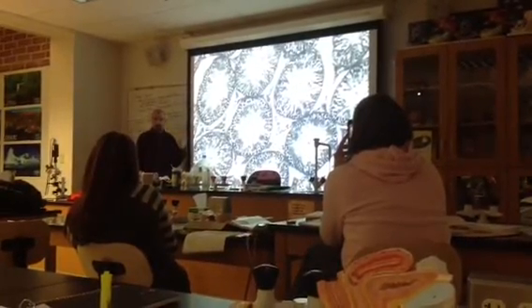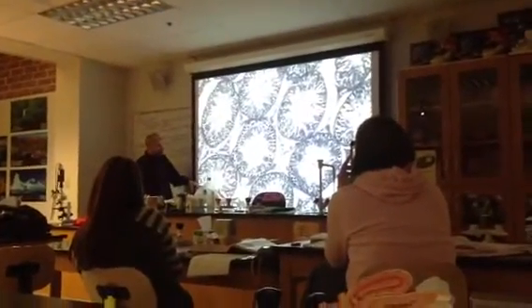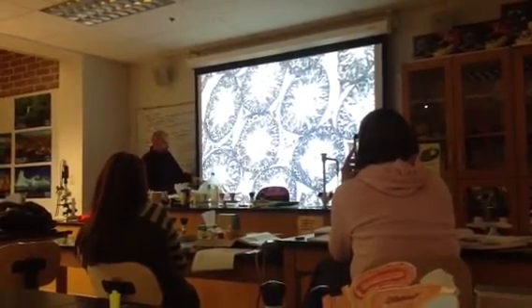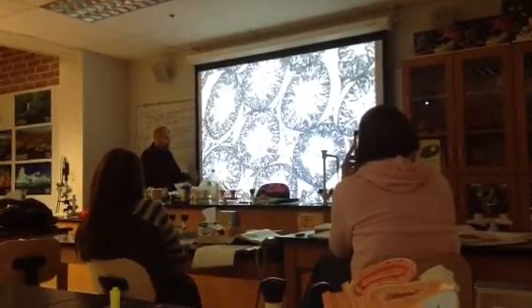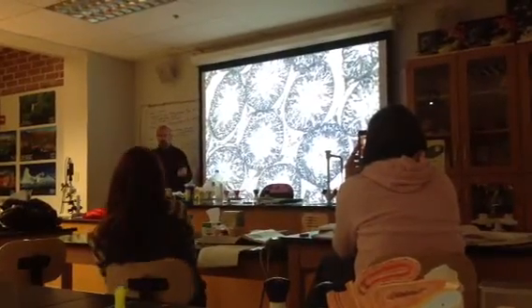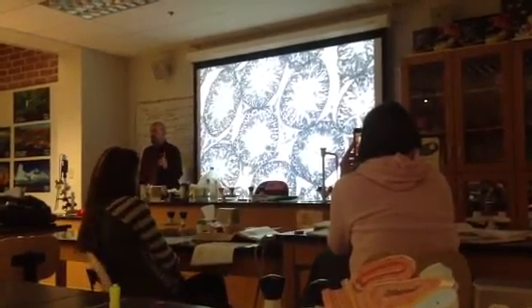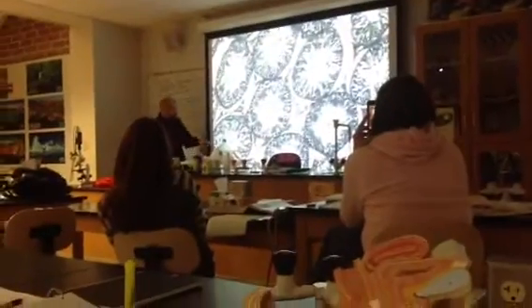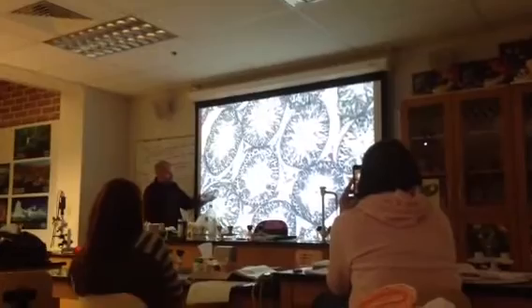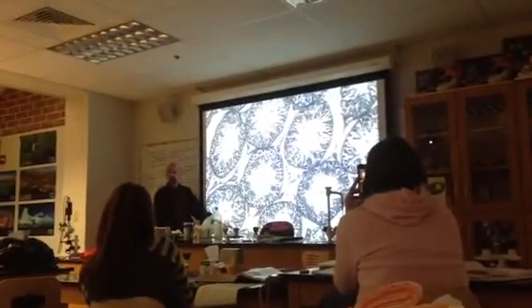So those anterior pituitary hormones that we were talking about, FSH and LH, and testosterone, all start stimulating meiosis to begin. And the first place where meiosis 1 occurs is between a primary spermatocyte and a secondary spermatocyte. So a secondary spermatocyte is the first time meiosis 1 has been completed, and now you have the haploid number of chromosomes. So basically, on the periphery, spermatogonia and primary spermatocytes, by the time you're somewhere in the middle here, you're going to start seeing secondary spermatocytes.